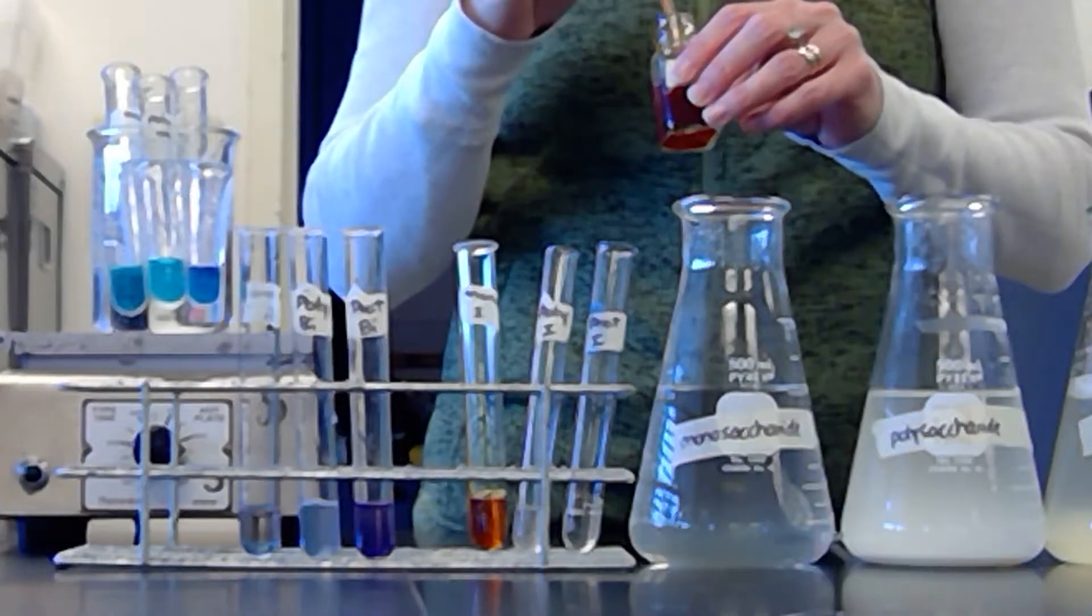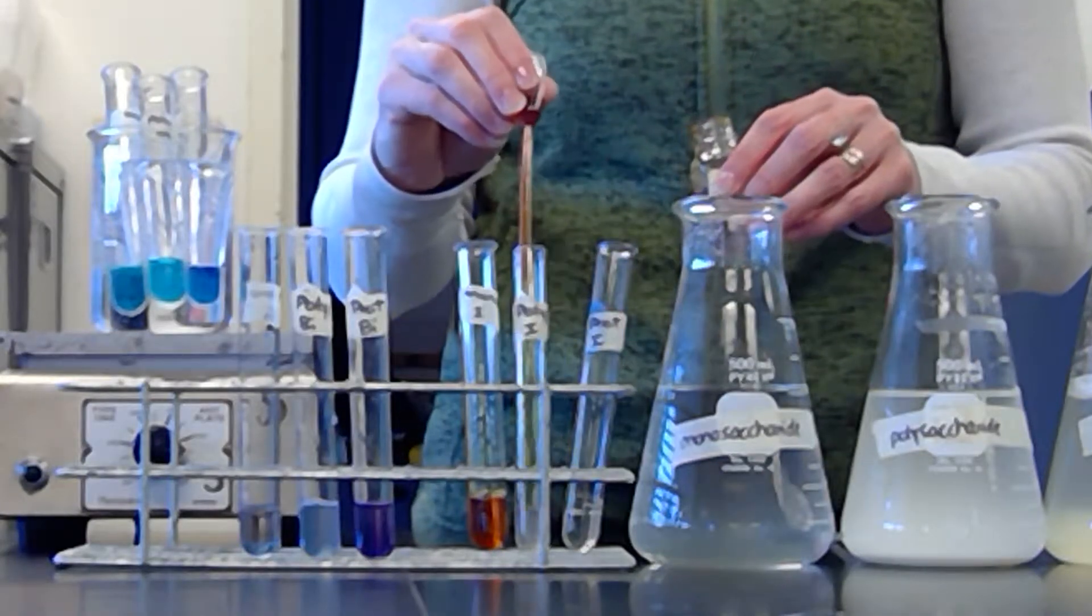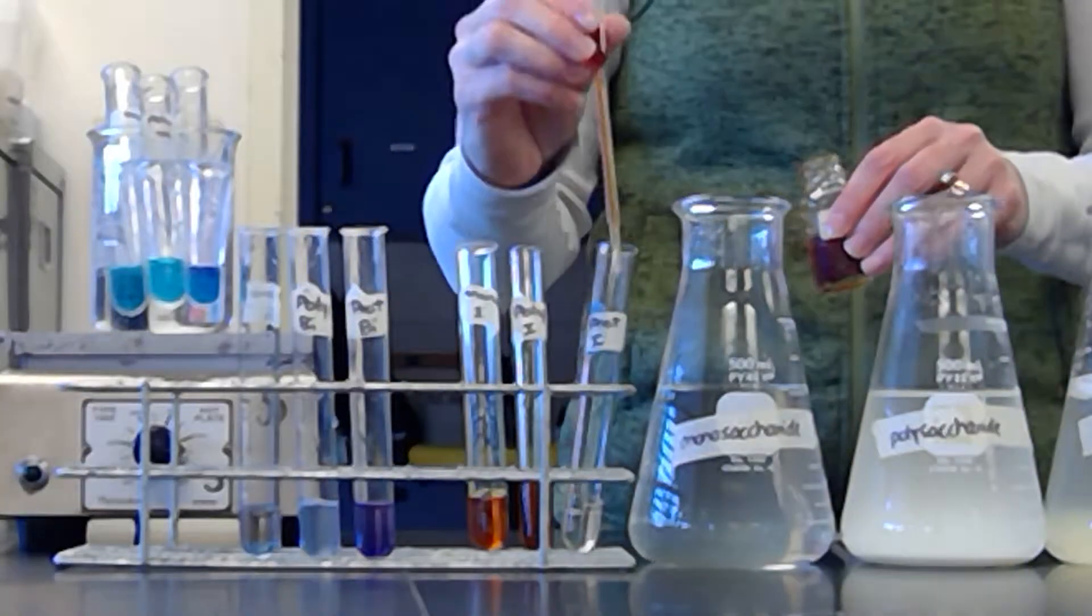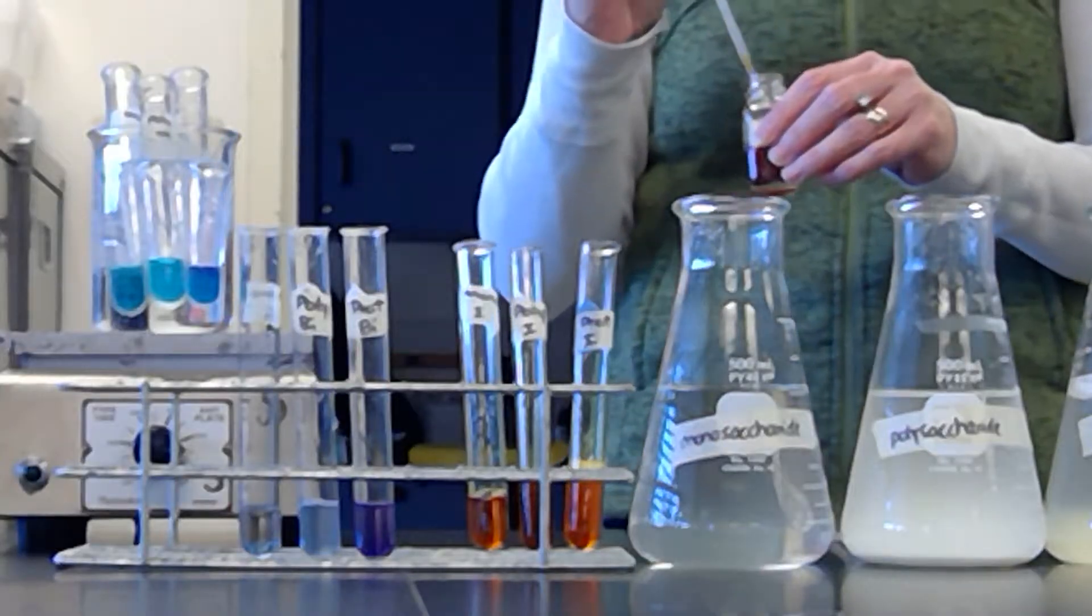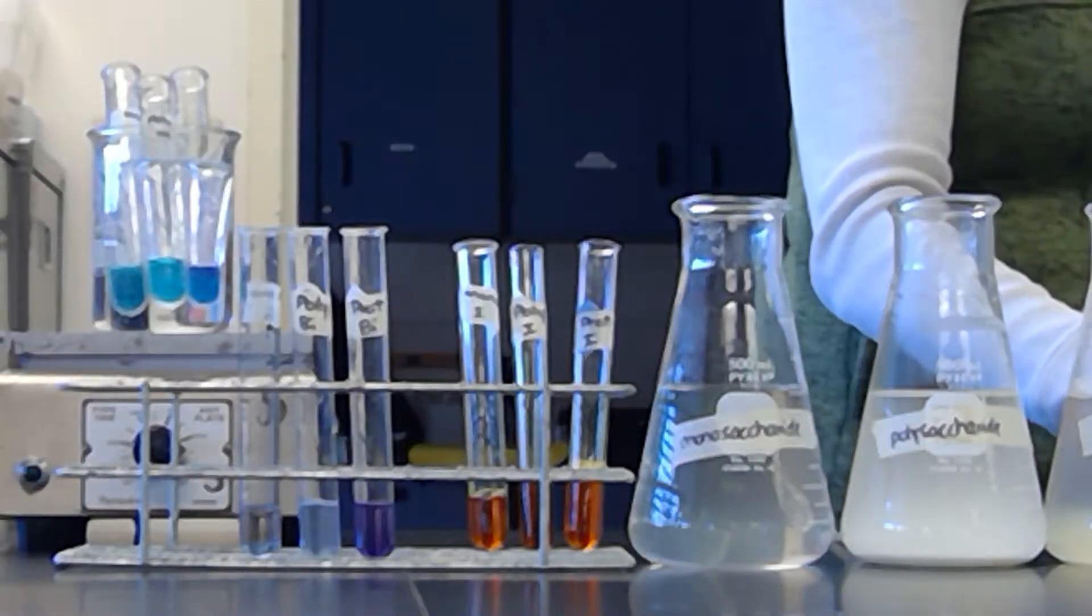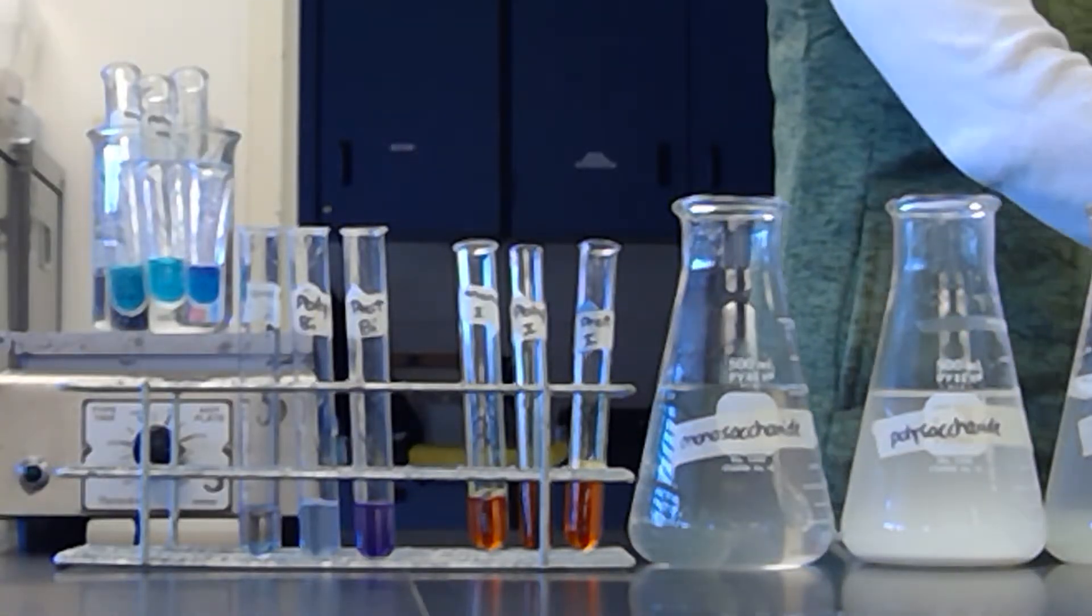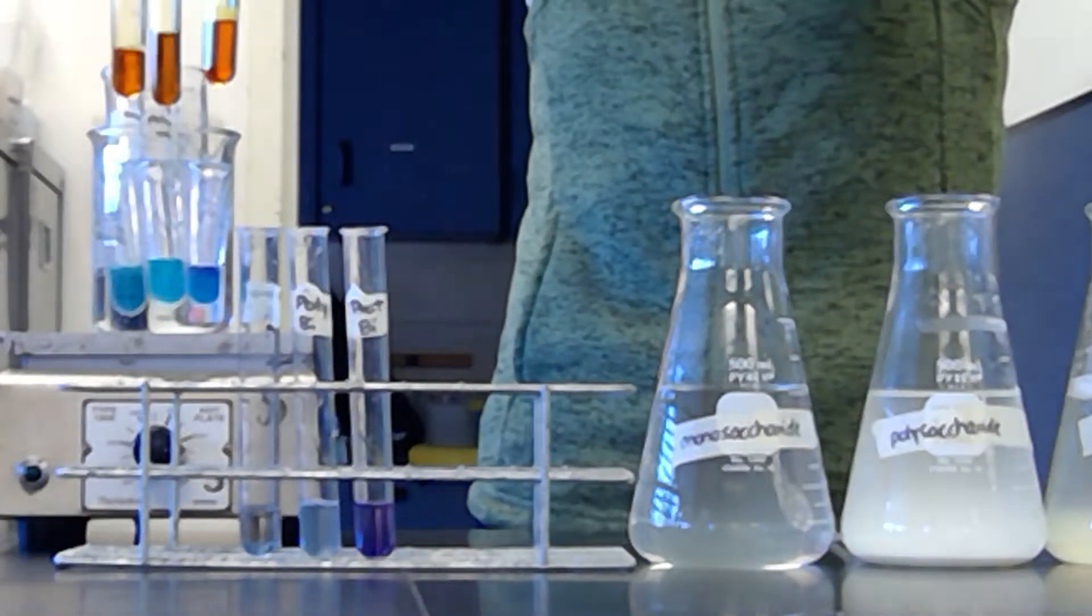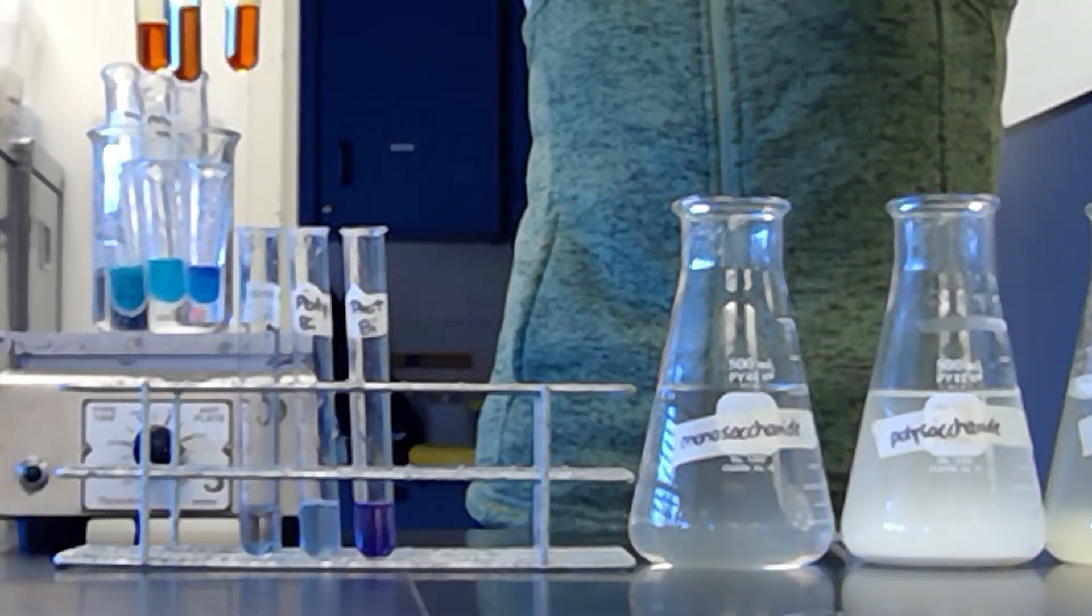So I'll take a squirt of iodine and I will put it in my monosaccharides. So it didn't do a ton. Put it into my polysaccharides, and then I put it into my protein.